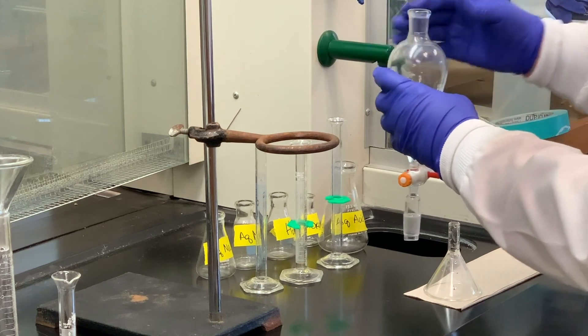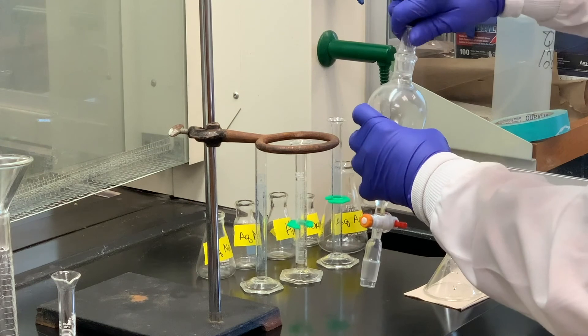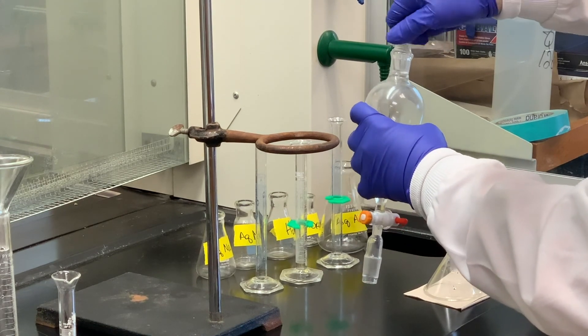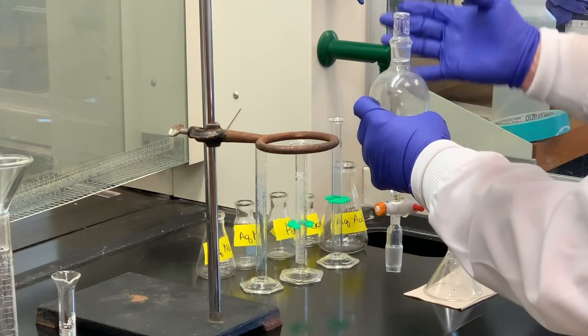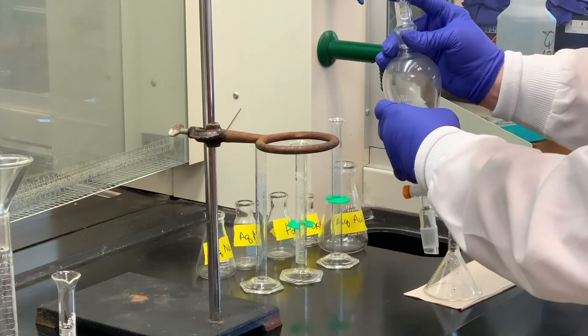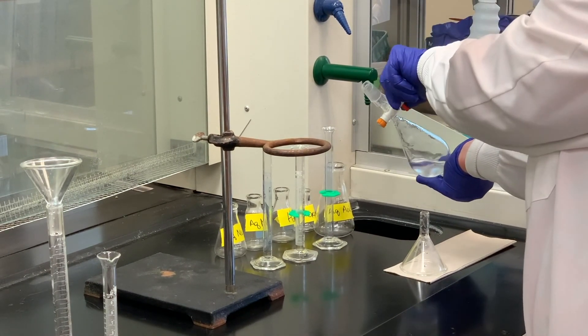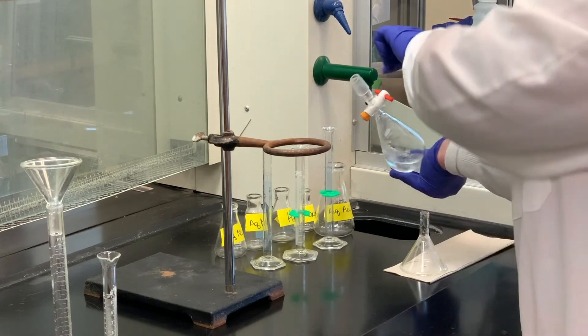All right, it's been about a minute. I'm going to put in the stopper. And again, always make sure you grease the stoppers that you're using inside your separatory funnel. Again, if you don't, it's very likely that some of the liquid, when you invert it, will actually spill out. So I'm going to swirl a little bit, vent. I'm going to swirl a little bit, shake.